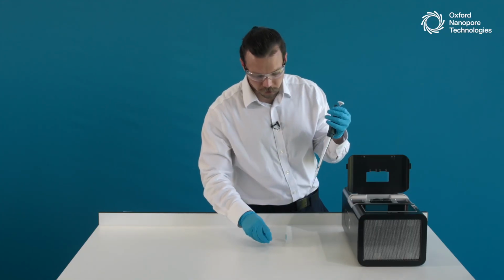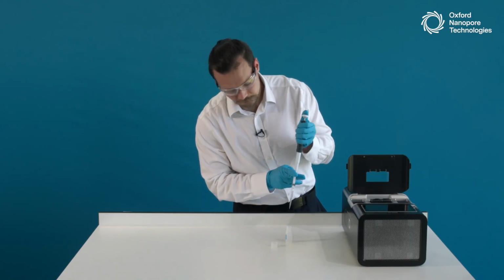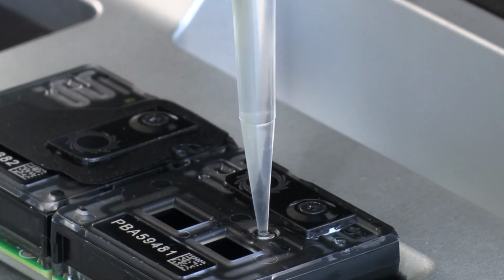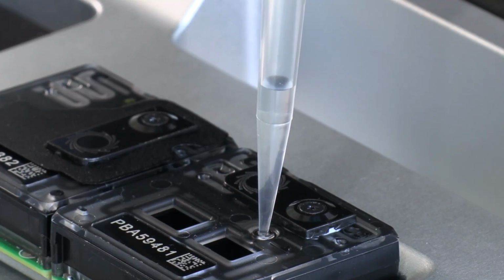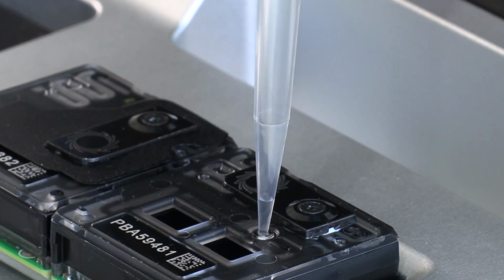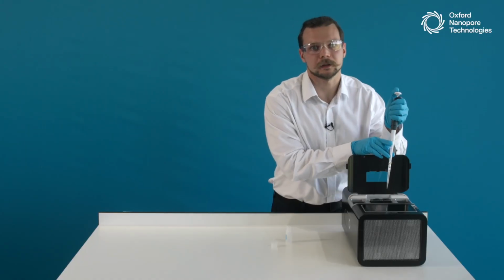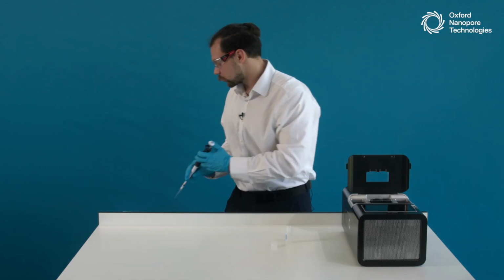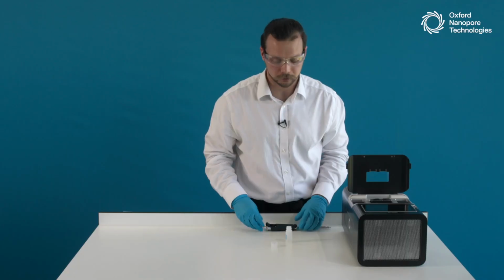So I will just finish and do the second step of PromethION Flow Cell priming by adding another 500 microliters of priming buffer into the flow cell, like so. Once again, I always recommend to leave a small amount of liquid in the pipette tip to ensure that you're not accidentally introducing the air. I'd rather not have irreversible damage on the flow cell than risk it when I'm expelling all the liquid.